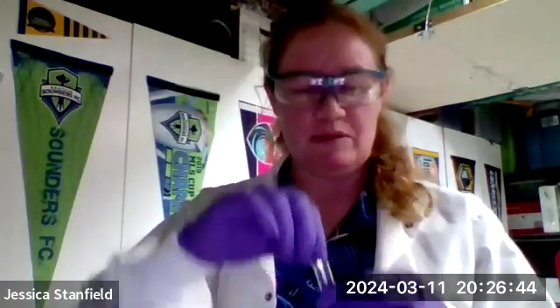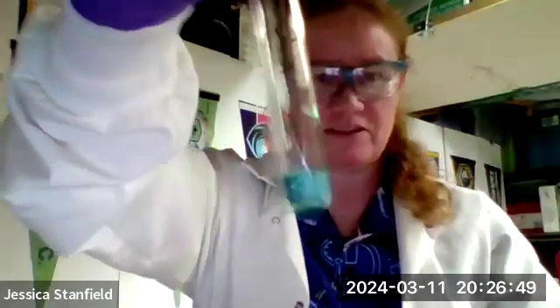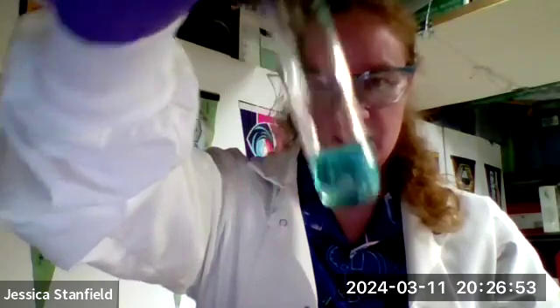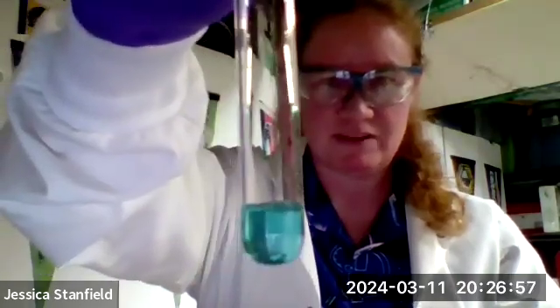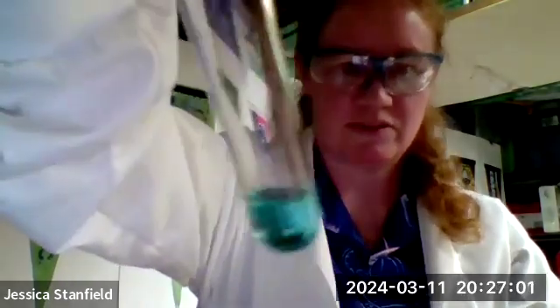Now, the blue color of the solution is coming from the copper(II) ion. So if I added enough aluminum foil, eventually we wouldn't see the blue anymore. Let's see what happens when I add some aluminum foil. These are not the fastest reactions. Sometimes they take a little bit to get going, but this one should get going pretty soon. Oh, of course, the piece I put in here is kind of floating on top. There we go. You can sort of see it.